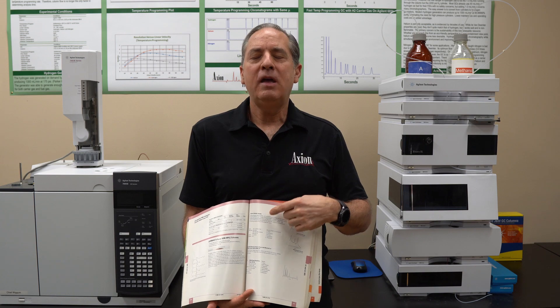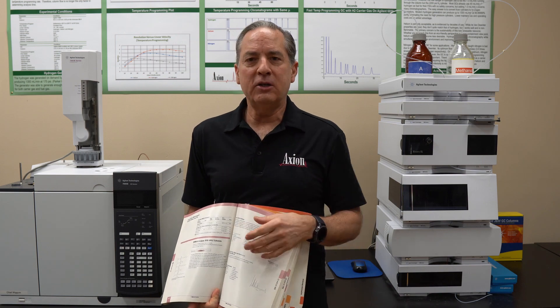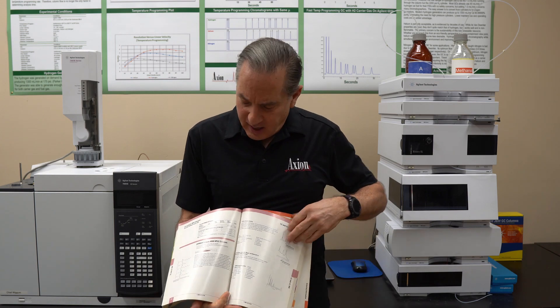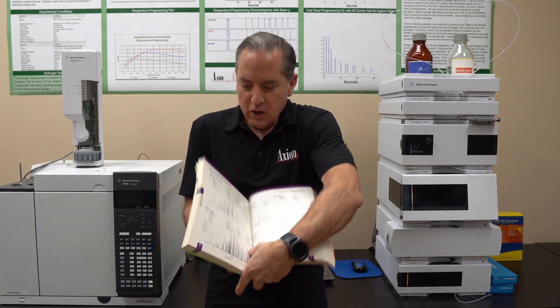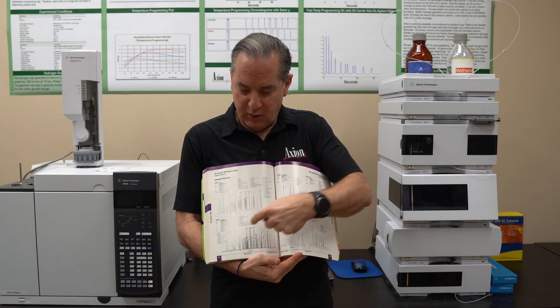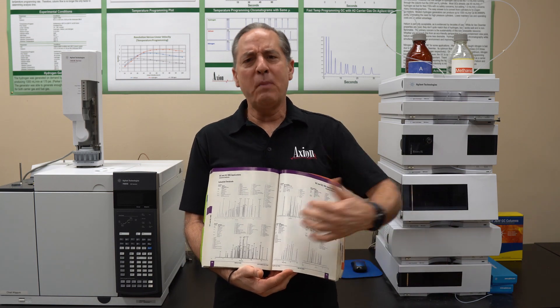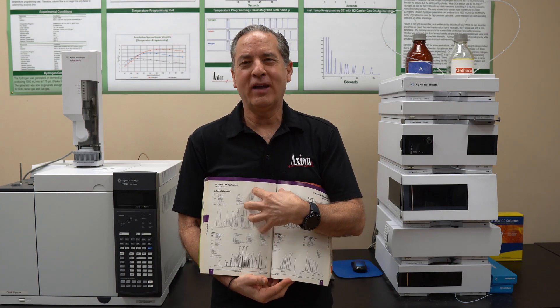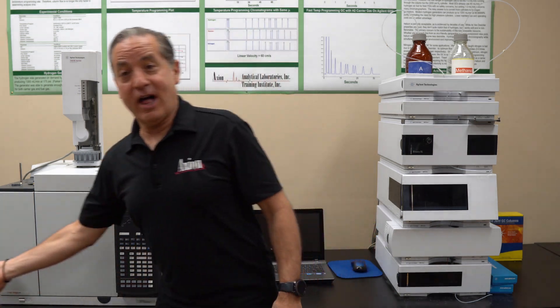There are thousands — tens of thousands — of applications out there. So if you're trying to separate benzene, toluene, and xylene, don't run to the lab and start injecting them. Run to the catalog and look them up. You may find a chromatogram more complex than you need — say 75 peaks when you only have three. That's a great starting point; then you optimize, make the run shorter, cut out some time. Step one is to find the right column in a catalog — it gives you a guaranteed result.